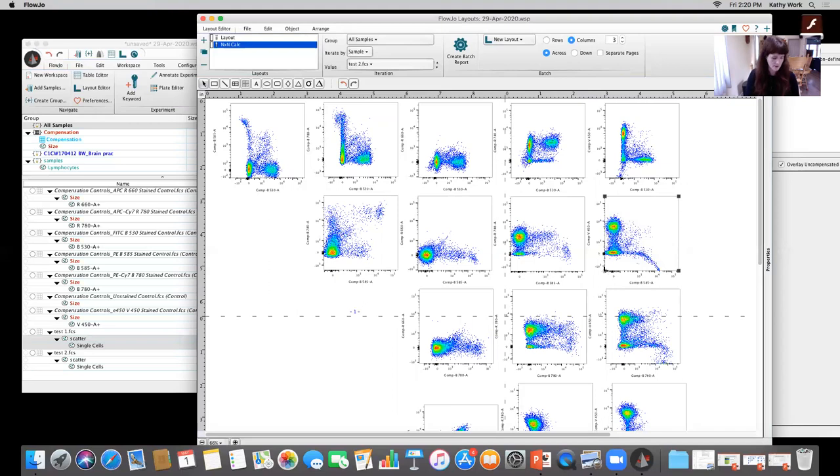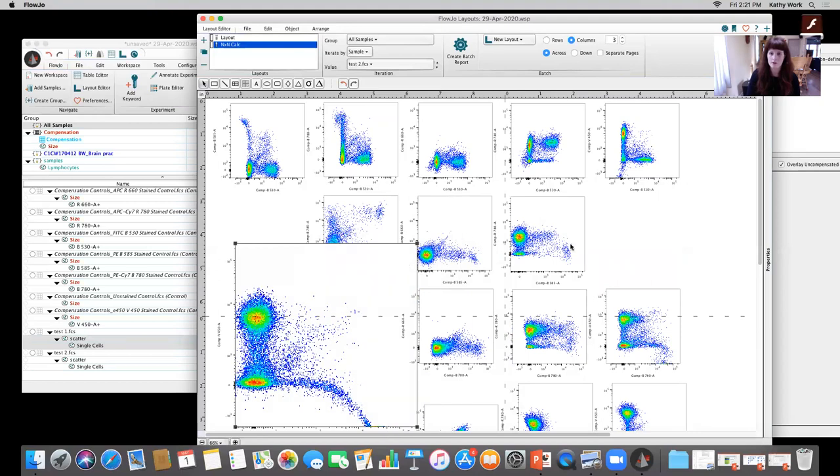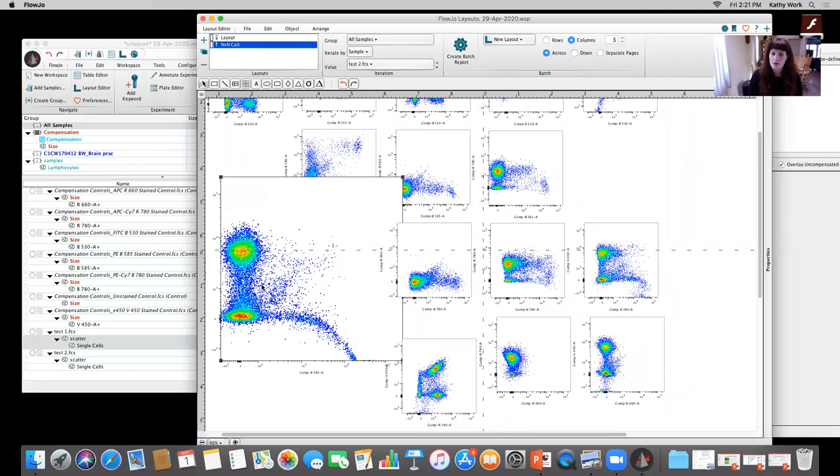Right, so what I'm going to do is hit the shift key, drag this out, and make it pretty big so that we can all take a closer look at it together. So why is this channel overcompensated? That's the question that you ask yourself when you see this data. Why is it happening? We're talking about troubleshooting, we're talking about trying to clean up our data and trying to make sure that we're looking at things in the appropriate way. And this is not going to give us good statistics, it's not gonna give us good results, and it's clearly overcompensated, okay? First thing I do is I go ahead and look at that single color control.